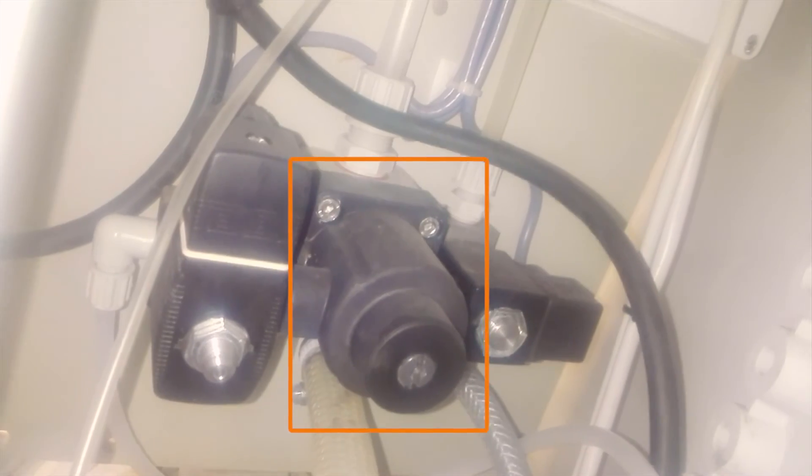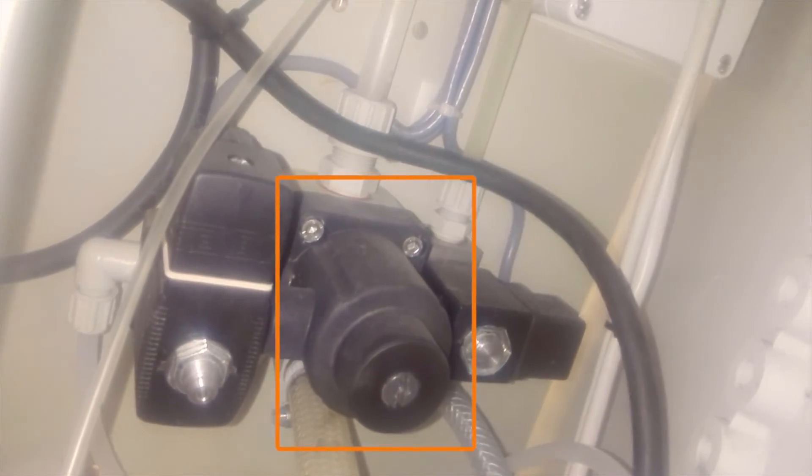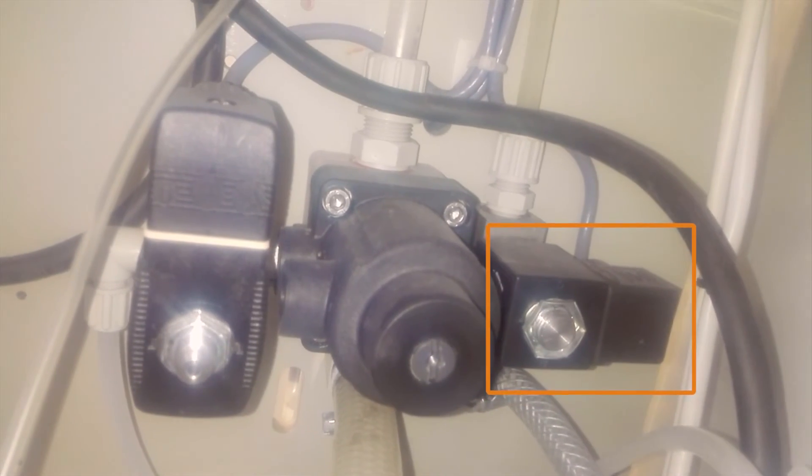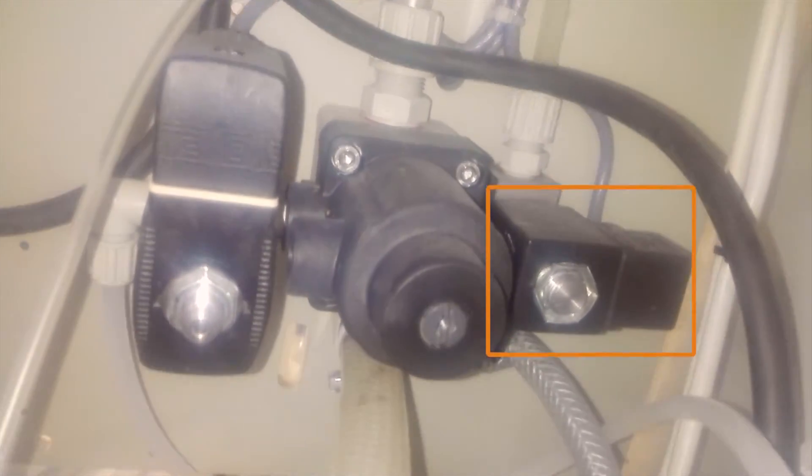On the downside, you can see two solenoid valves. One is to operate the sample valve. The sample valve is an air-operated pneumatic valve we are using to get sufficient flow of sample. The second solenoid valve is used to operate the sprinkler to rinse the reactor chamber and electrodes using deionized water or demineralized water.